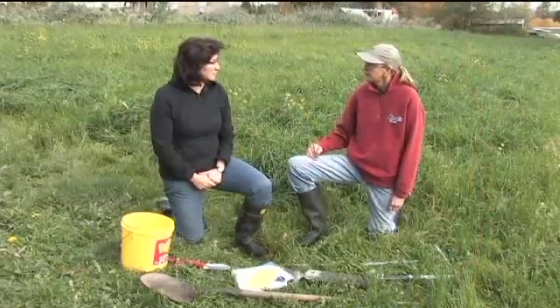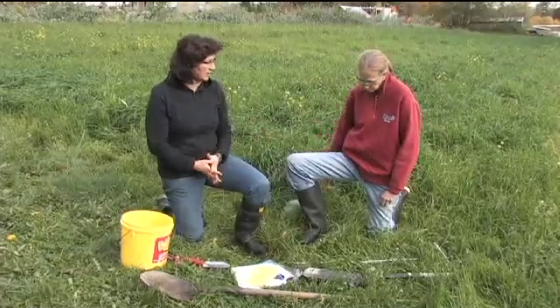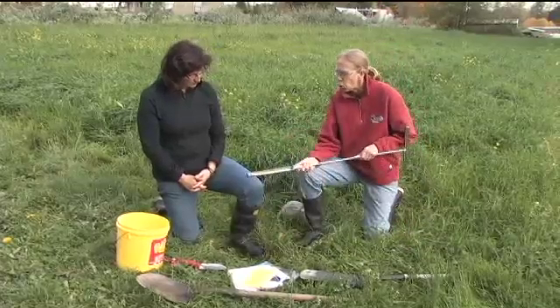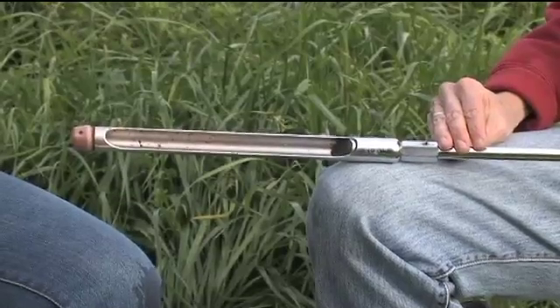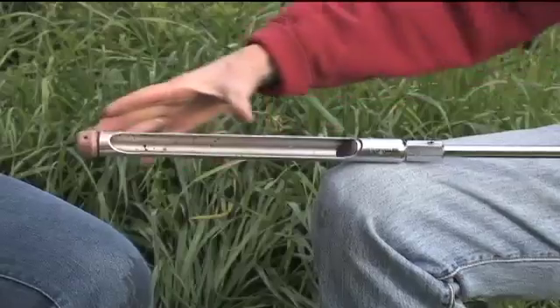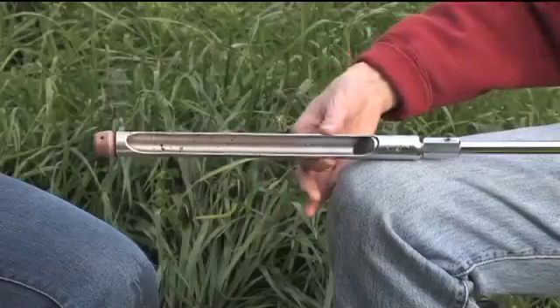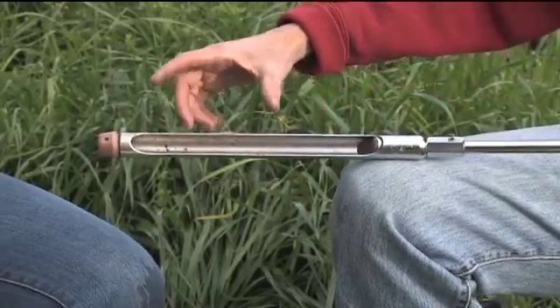How would you go about collecting soil samples? Would you have some special kind of equipment for that? Sure, there are different cores, or we can use a shovel or dig. I like to use this Oakfield core. I particularly like this core for sampling in fields like these where we don't have a lot of stones. We just push the barrel of the core into the soil — there's an angled tip here — and the soil comes up into the barrel, and we just pull it straight out to get a sample.